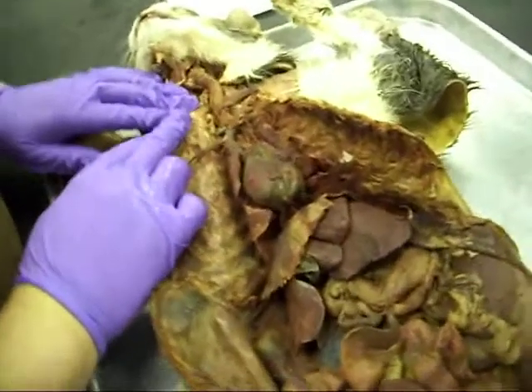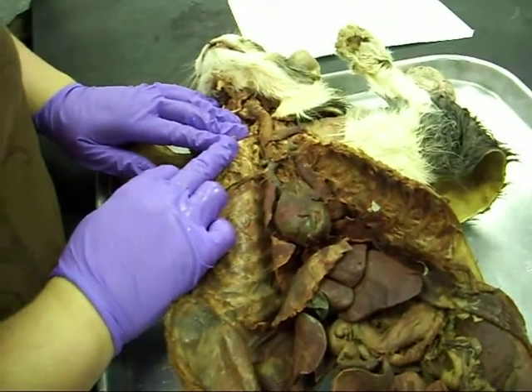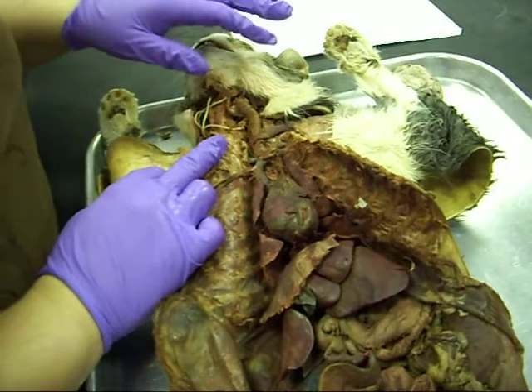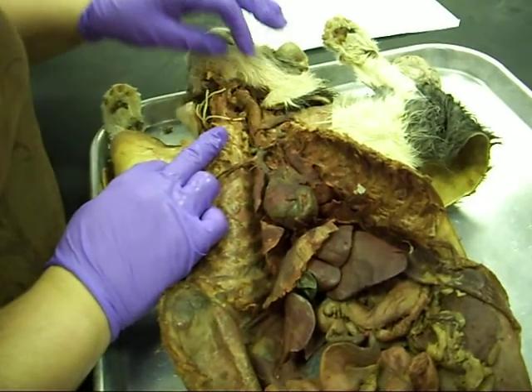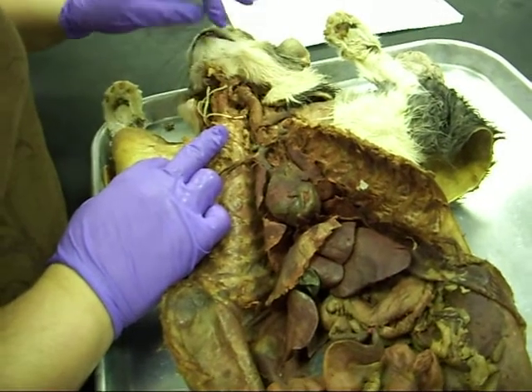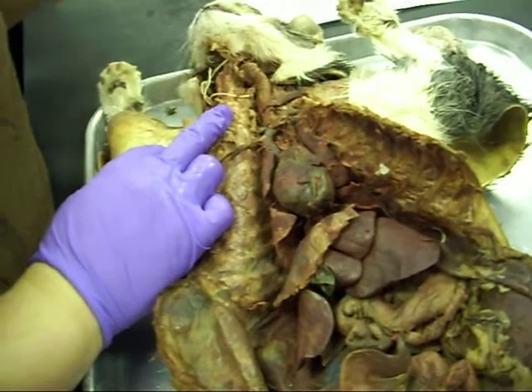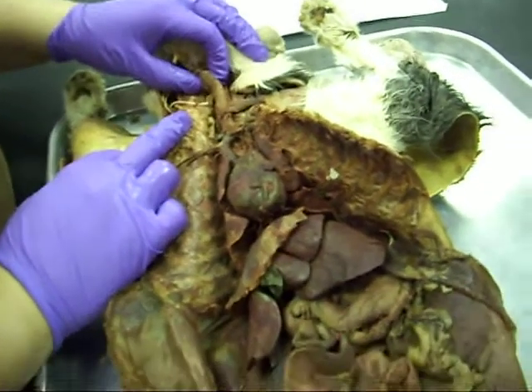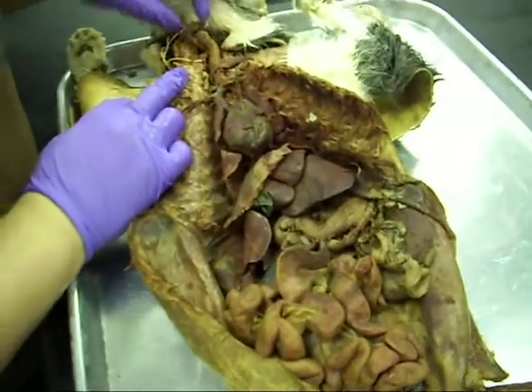We're going to try to identify as many structures as we can. We'll do veins and arteries on the next one, but we're going to just do the main structures. This is a male kitty cat with non-intact testes, so we're going to have to get a different one for that.